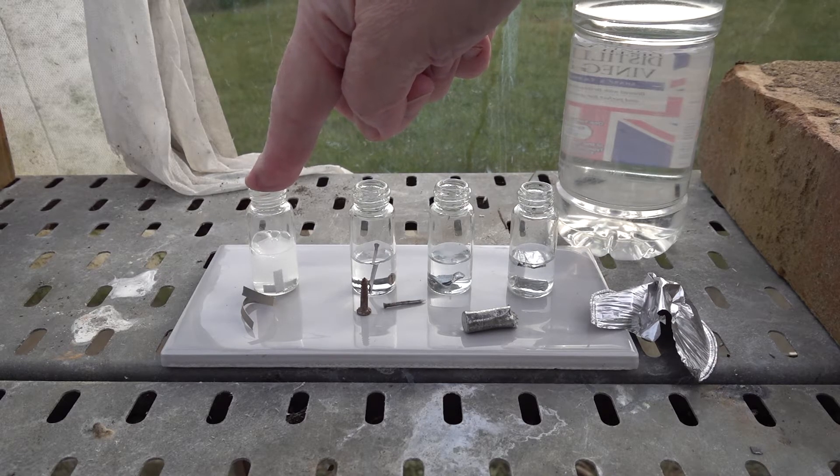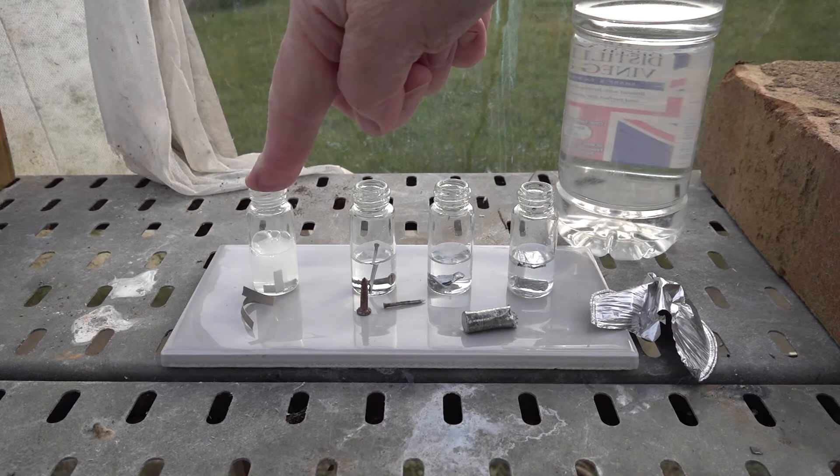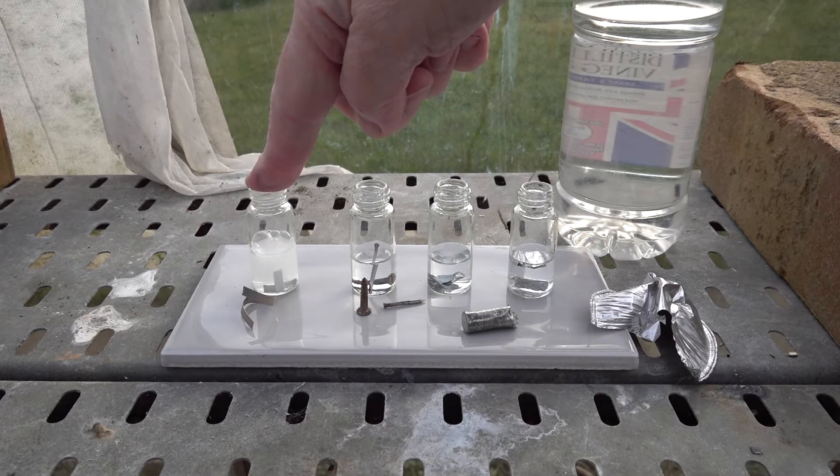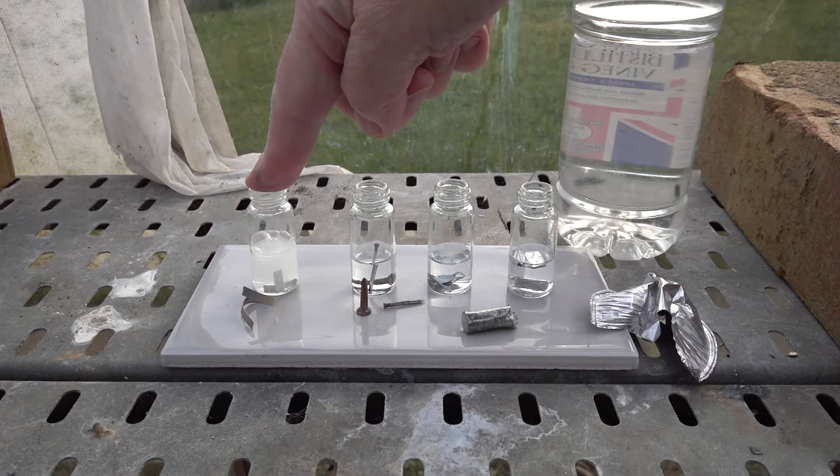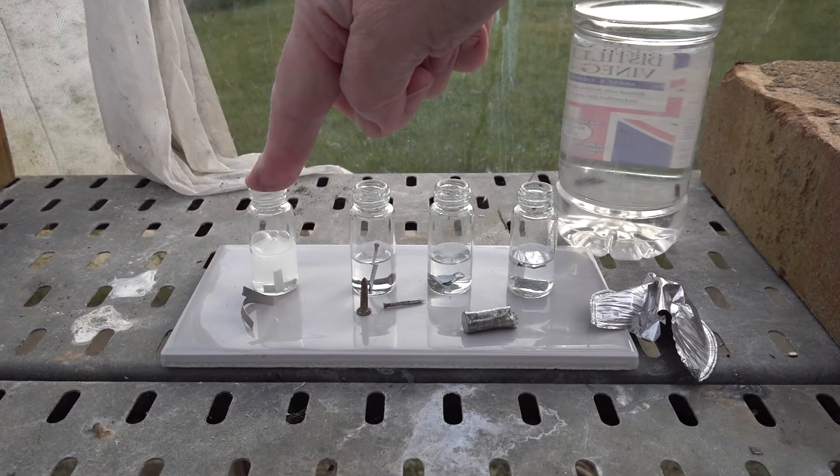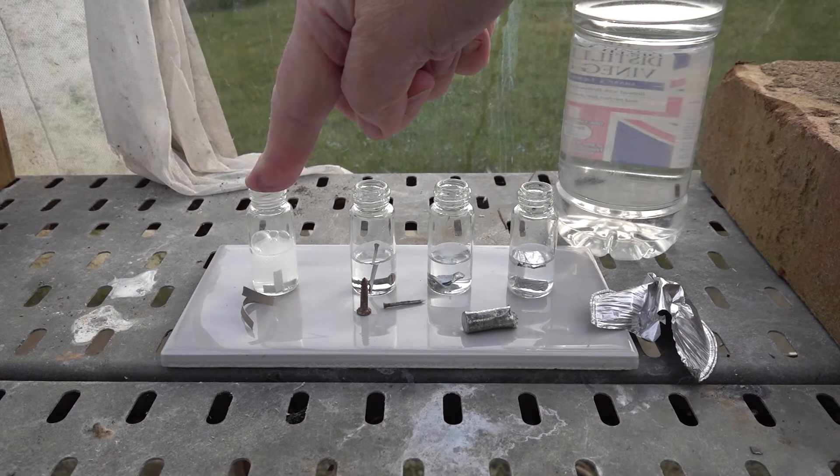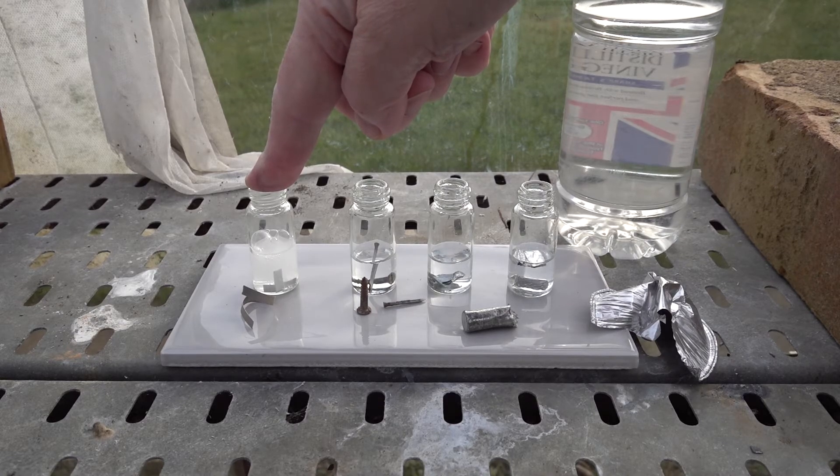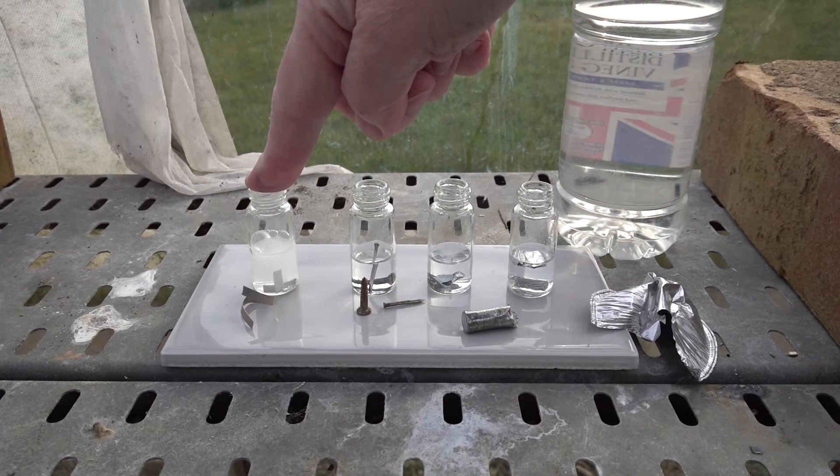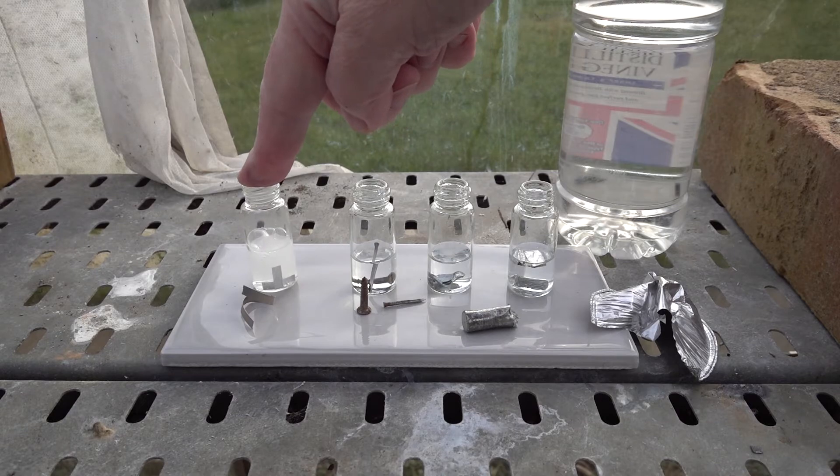Very small scale here, but we're hopeful for a positive test. We will be testing with a lit splint or burning splint. Let's give that a go.